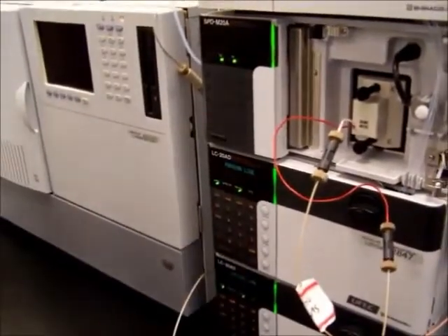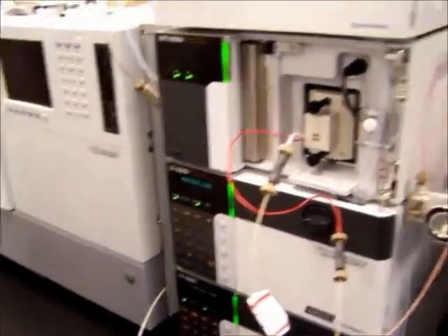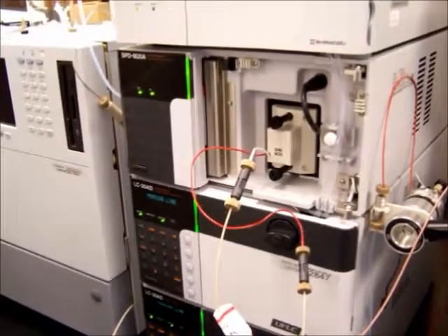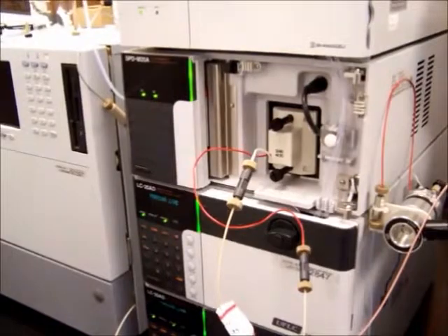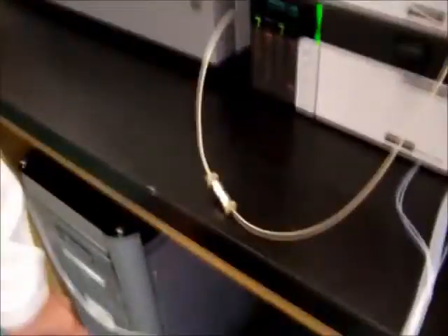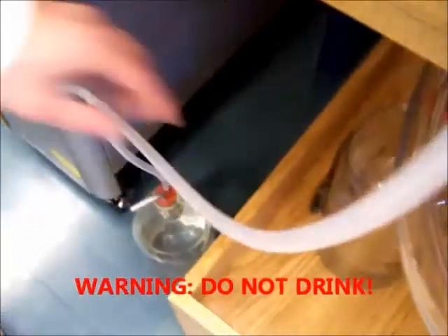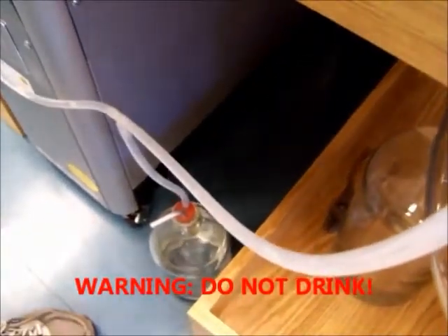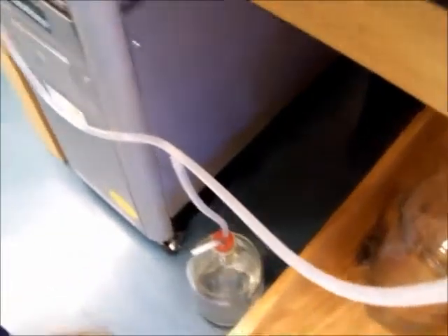The purging is important because the purging removes any air within the lines. If there's any air traveling through the lines, it will back up through the instrument and basically the machine won't work. And if you look down here, you can see the waste traveling through the waste line into the waste. So purging will typically take about 5 minutes. If the nebulizing gas has not been turned on, the pumps will shut off after about 30 seconds.